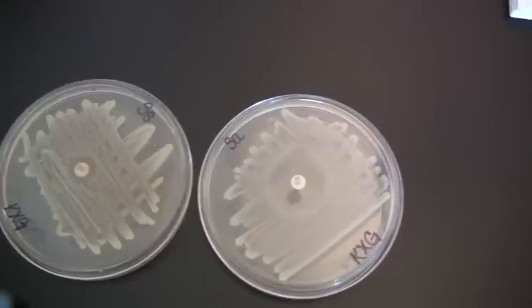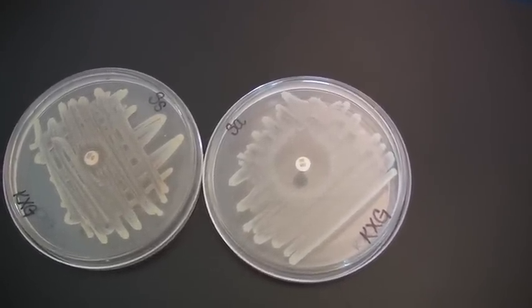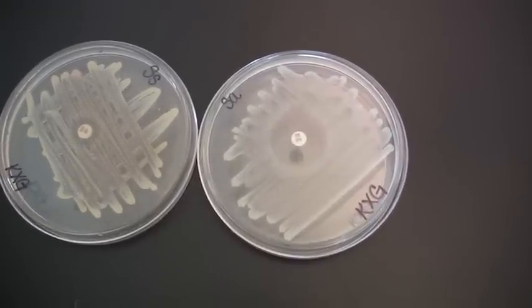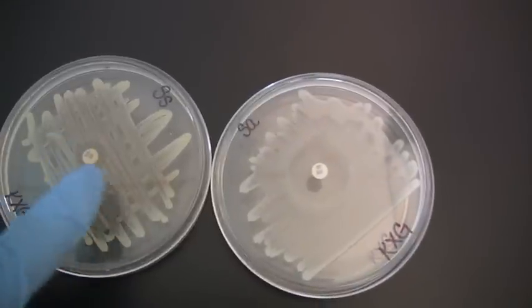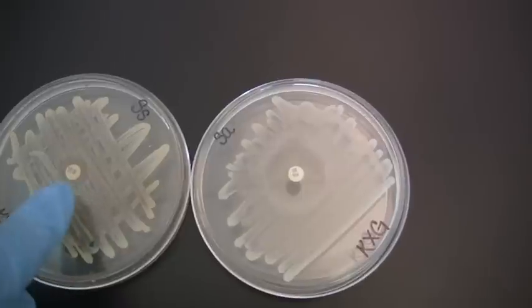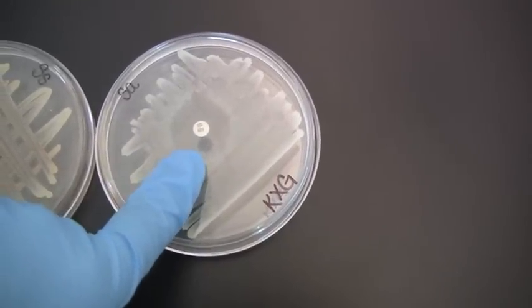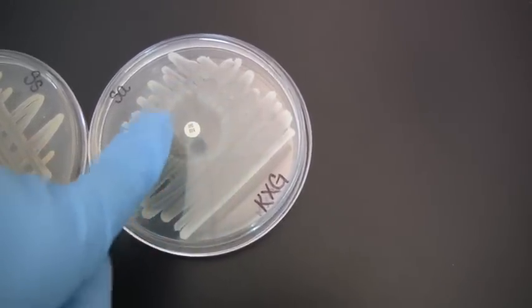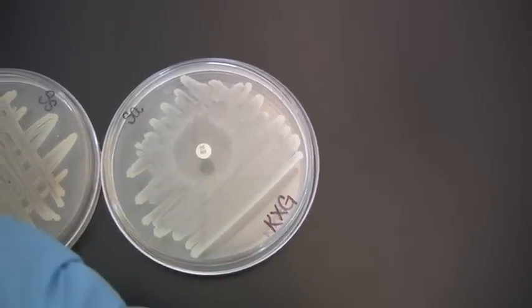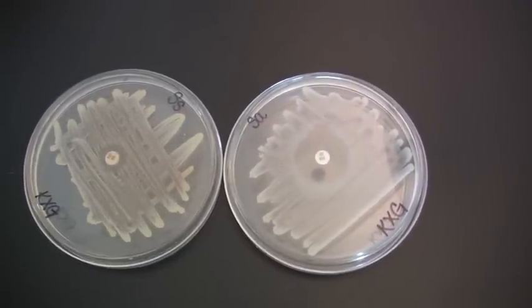You can look at a variety of other antibiotic discs, and the zones of clearing are always different, as I mentioned, so please make sure that you review that to make sure that you're looking at the appropriate zone of clearing to see how many millimeters should be clear of growth. So again, the one on the left is considered antibiotic resistant because there's growth really up to and heavy growth very close to the disc. The one on the right here is considered antibiotic sensitive because the organism has been prevented from growing with at least a 16 millimeter diameter away from the disc. And that is the overview of a Novobiocin antibiotic sensitivity test.